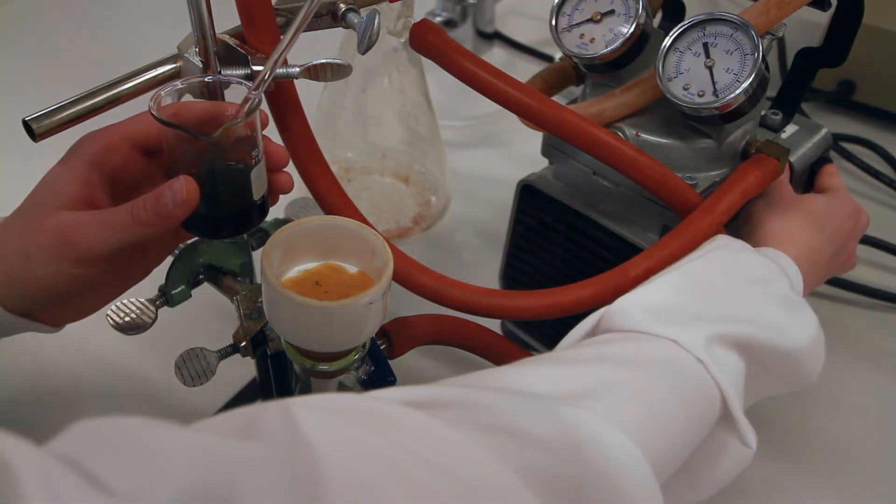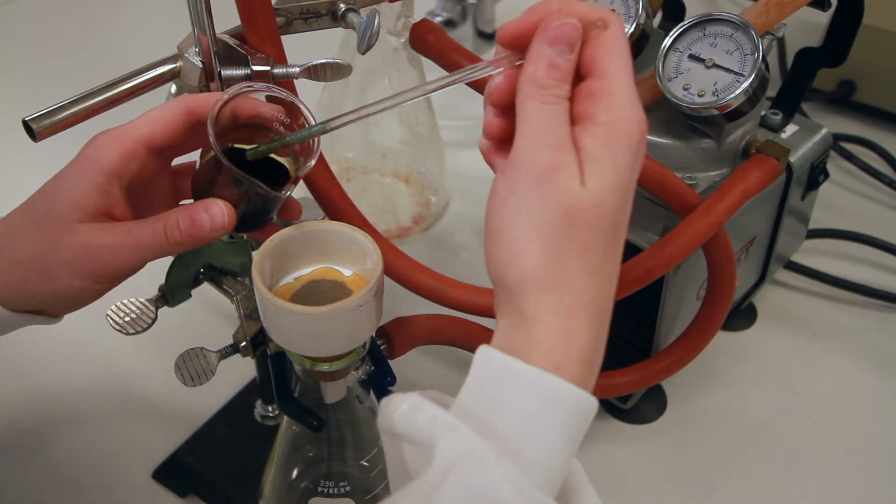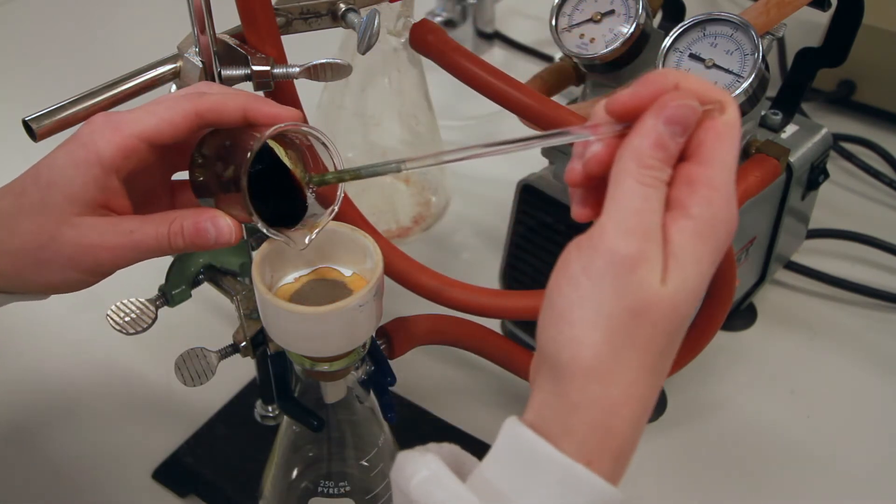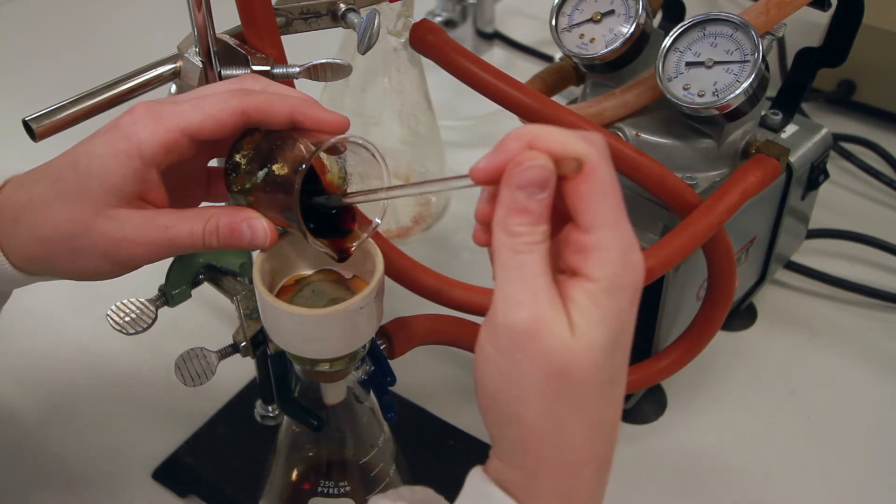Turn on your vacuum pump and begin pouring your solution into the Buchner funnel while scraping your crystals out using a stir rod.